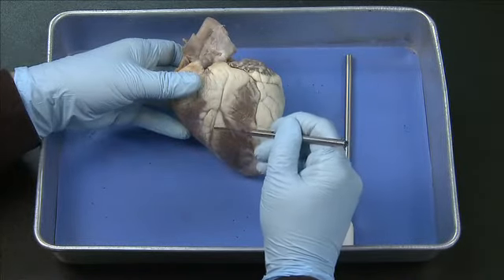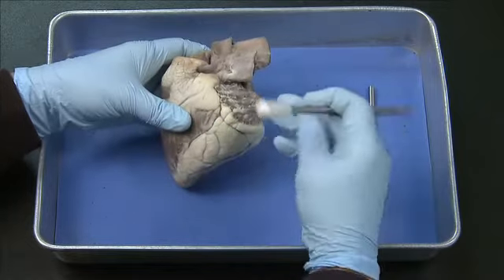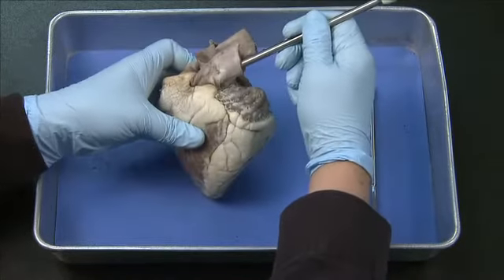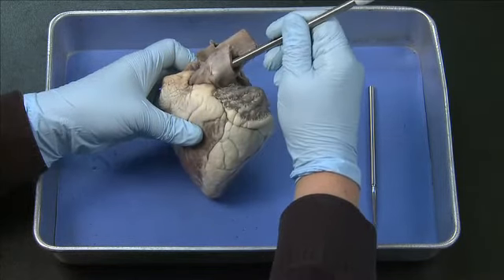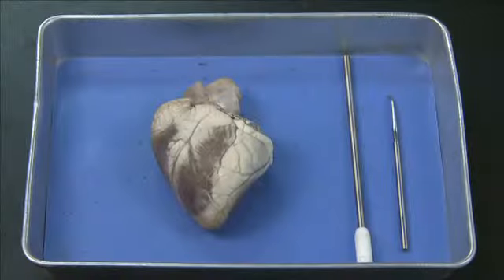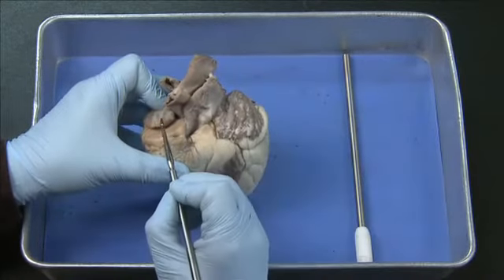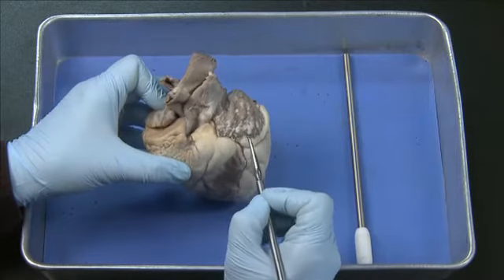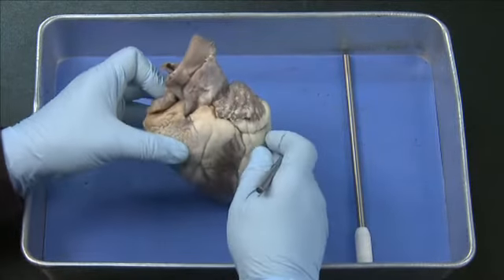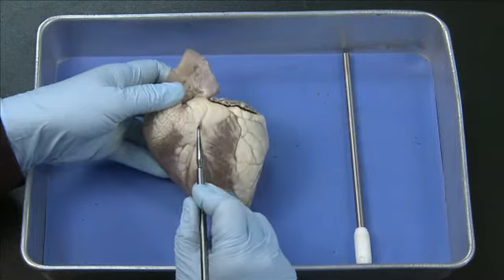I can see the interventricular sulcus right here, separating the right and left sides of the heart. And then here I can see the pulmonary trunk — this large vessel exiting the right side of the heart. These are your landmarks for orienting the anterior side of the heart. Now we'll look at the four chambers externally. You can see the right auricle and the left auricle, those wrinkled ear-like structures which are the anterior parts of the atria. And then we can see the right ventricle and the left ventricle separated by the interventricular sulcus.